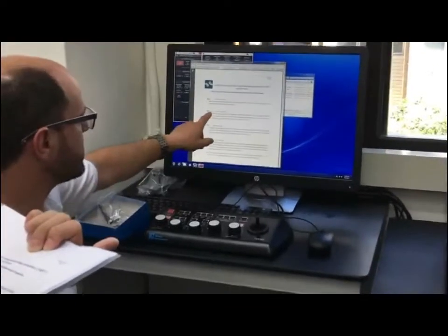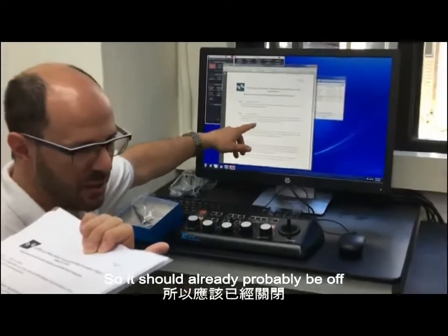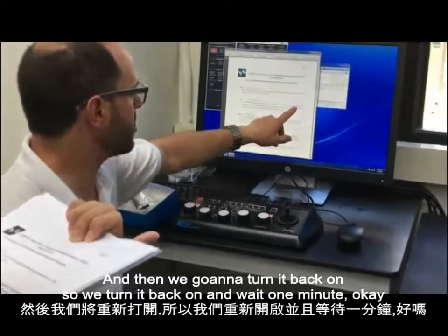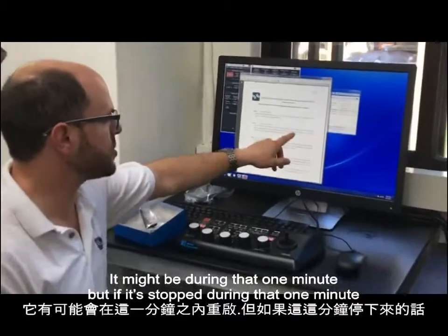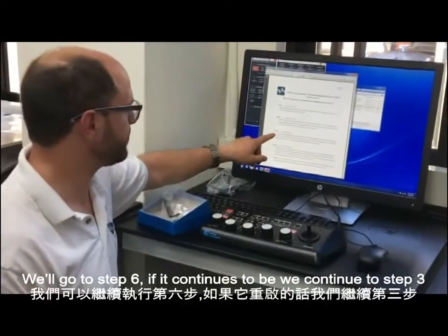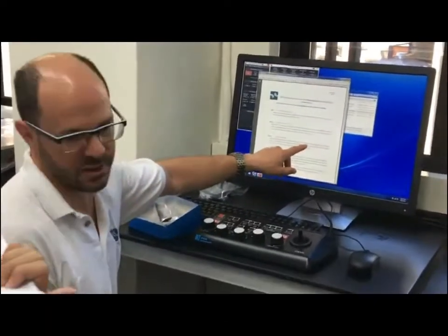Okay? Step 2 takes about 2 minutes. Switch off the ion pump module, so it should already probably be off. Okay? If it's not off, we make sure that it's off. And then we're going to turn it back on. So we'll turn it back on and we'll wait 1 minute. Okay? It might beep during that 1 minute, but if it stops during that 1 minute, we'll go to step 6. If it continues to beep, we continue to step 3. Okay? So if the alarm keeps ringing, switch off the ion pump button and start the turbo pump, if it's not already on.